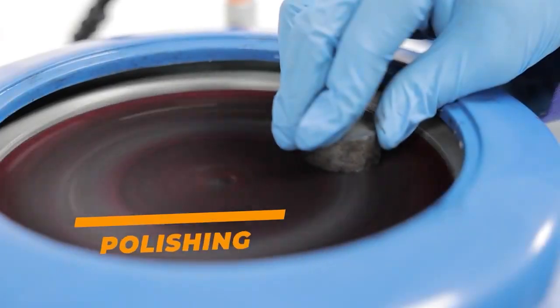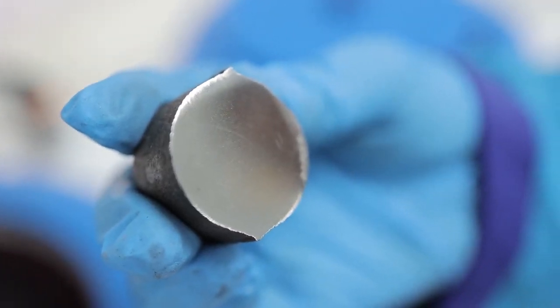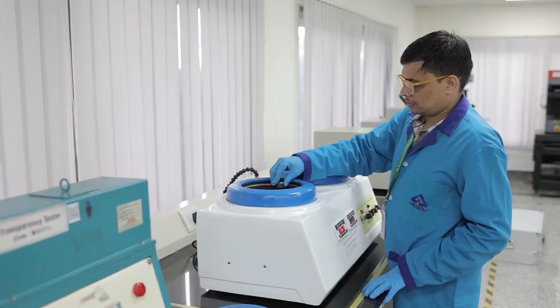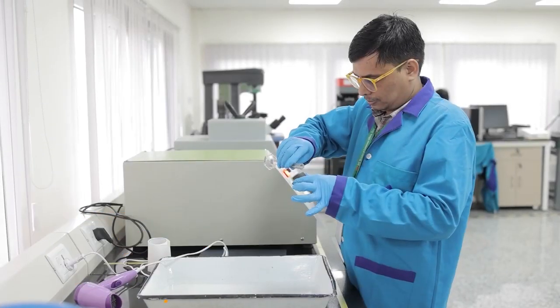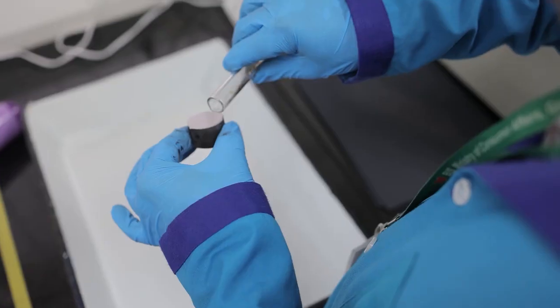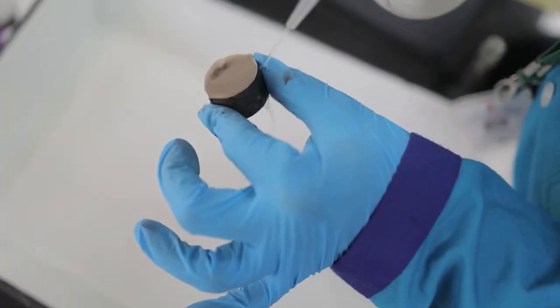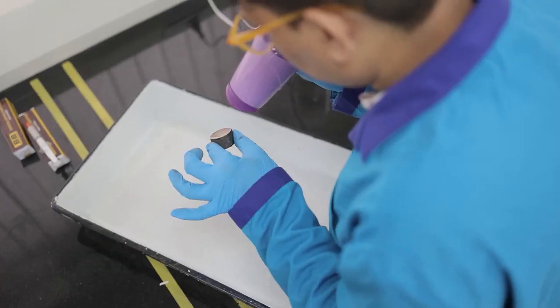Polishing. Polishing removes scratches from the grinding process and produces a mirror-like surface. It is done with increasingly fine diamond paste or polishing cloths to achieve a smooth finish on a double disc grinder. Etching involves treating the polished sample with the chemical reagent Nital solution to reveal the microstructure. Different etching solutions highlight various structural features such as grain boundaries, phases, and inclusions.